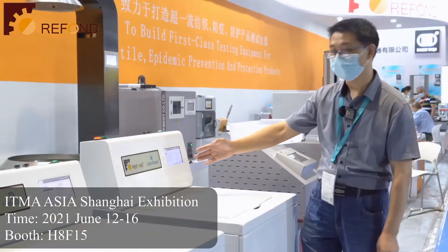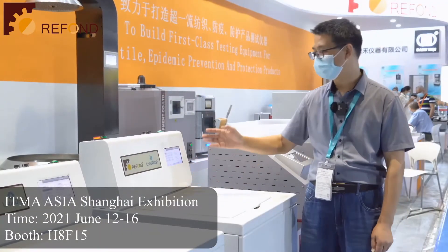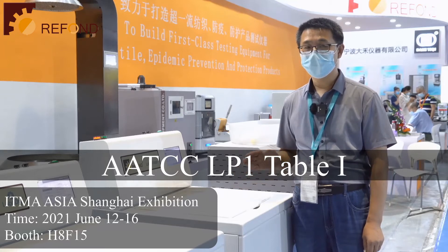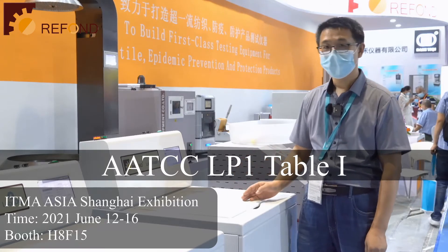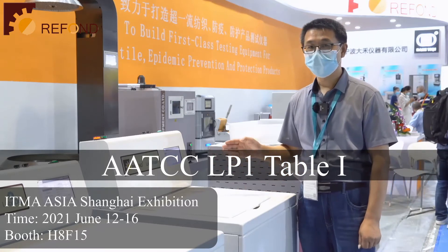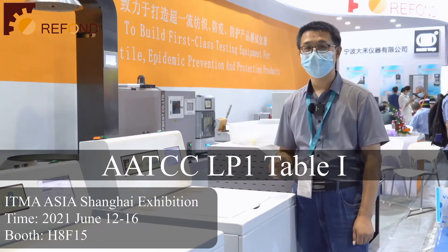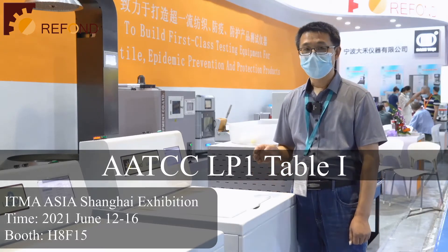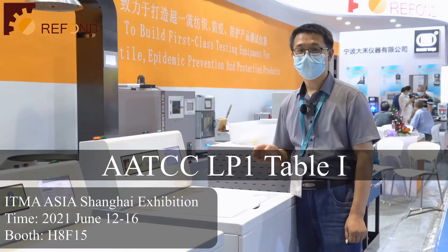This is a LaboWash washing machine, for AATCC Laboratory Procedure 1. The LaboWash washing machine can meet the AATCC testing standard, Laboratory Procedure 1, Table 1.